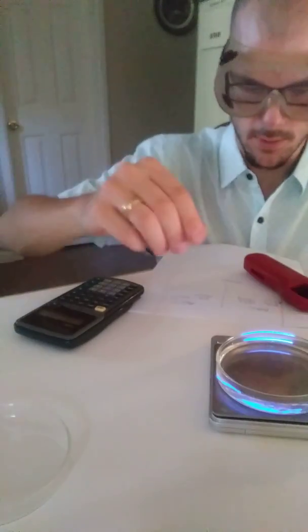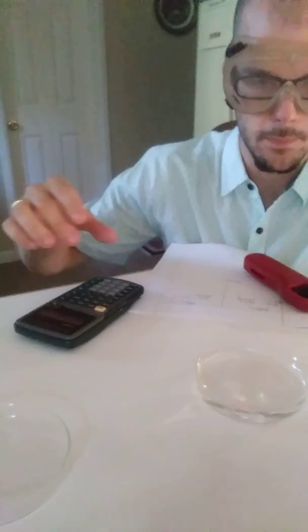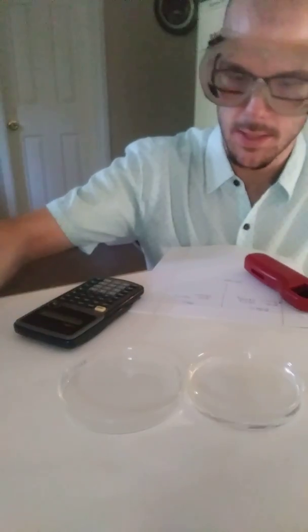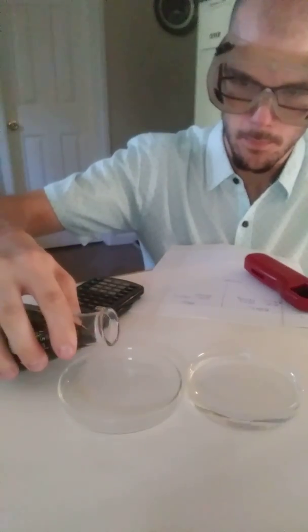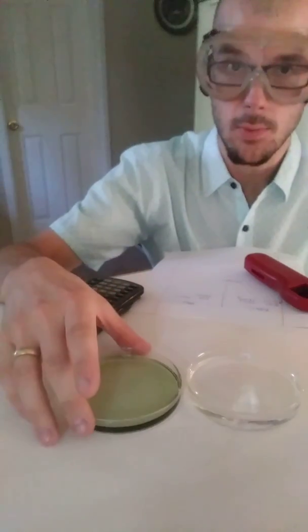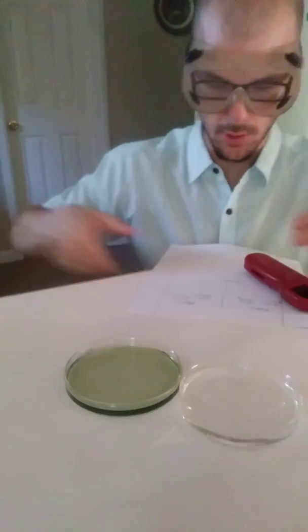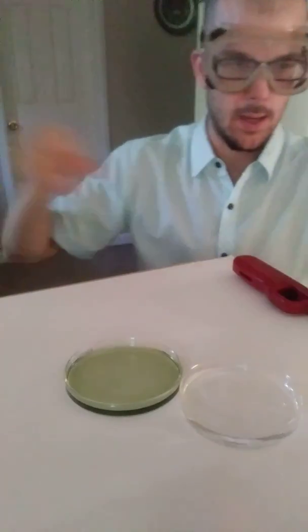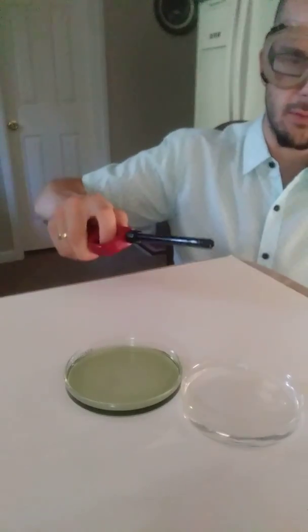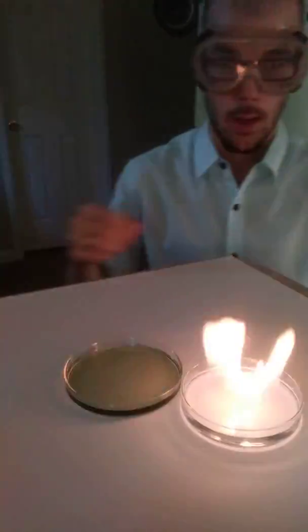I'm going to take this off the scale — we have the mass of our ethanol. We're going to put some BTB right next to it. Our BTB is green, which means it's beginning as a neutral substance, and we're going to give this a quick light with our flame.